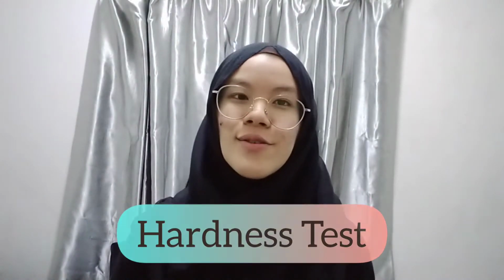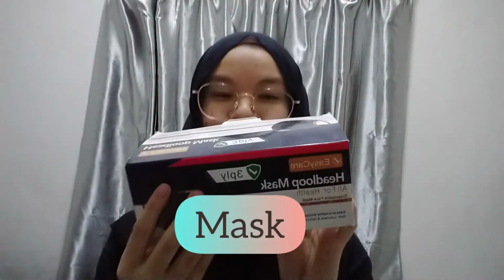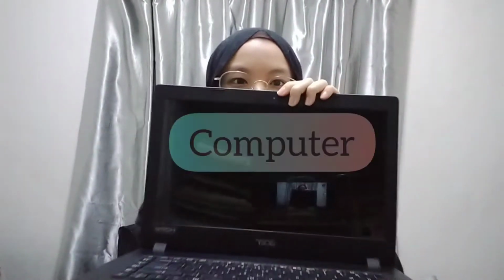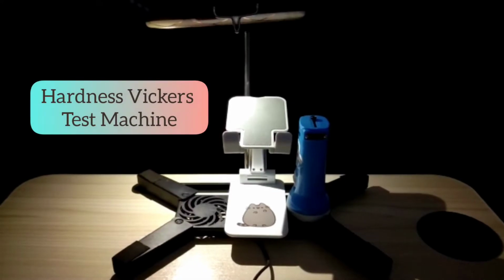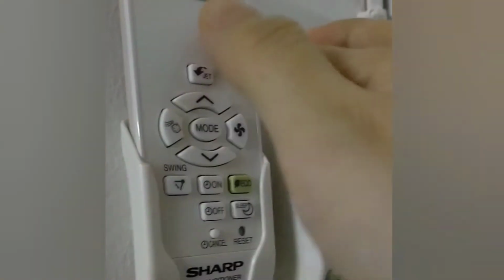Today I'm going to show an experiment called the hardness test. So let's go. Don't forget to wear your mask and gloves, and switch off the machine after it is used.